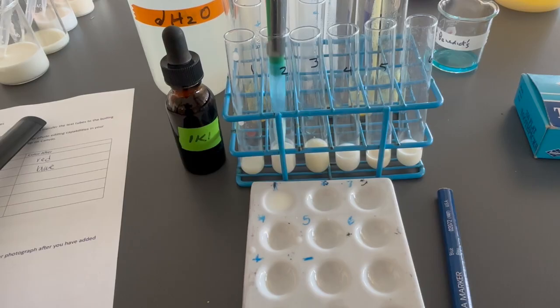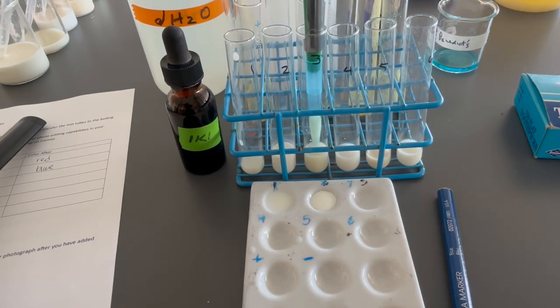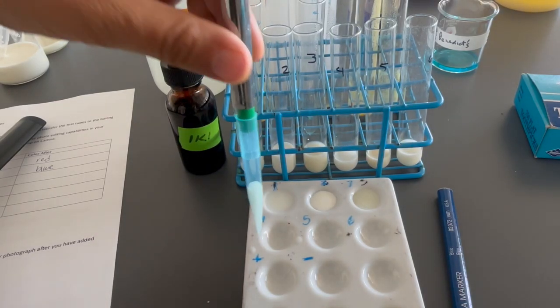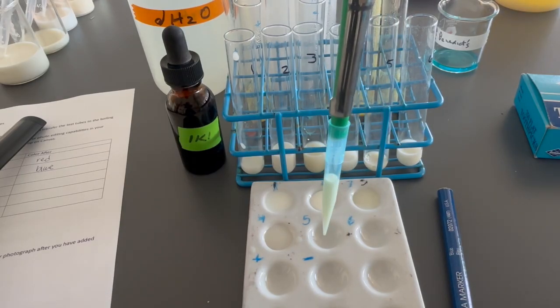Sample 2 goes in well 2. Sample 3 was a weird one.